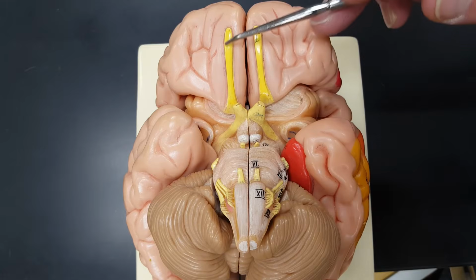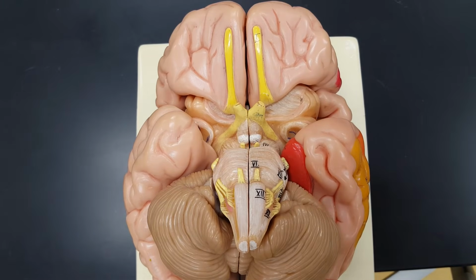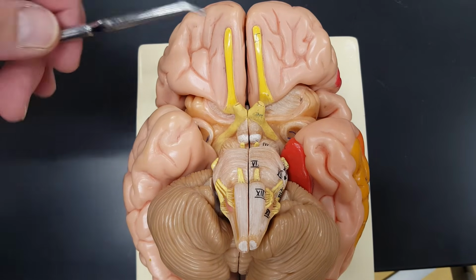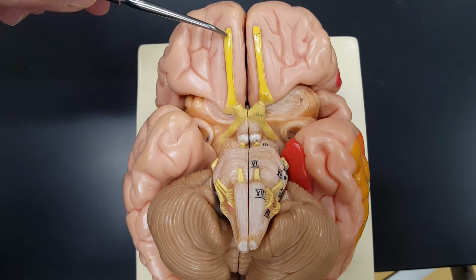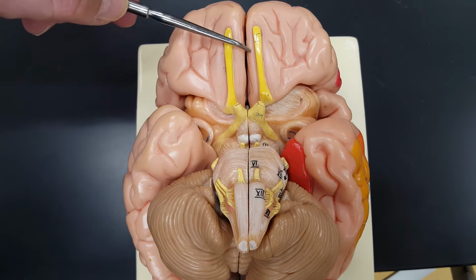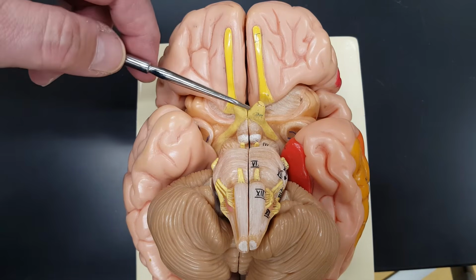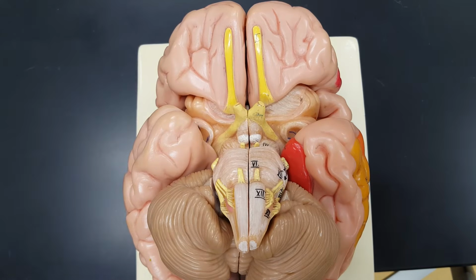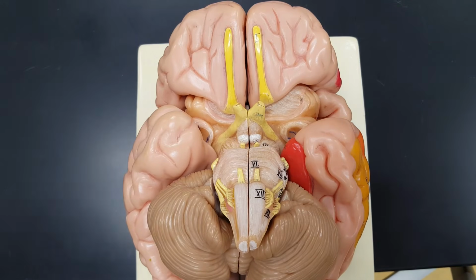These two big nerve tracts are your olfactory nerves for smell, the olfactory nerves. Notice the bulb at each end. So this structure right here is the olfactory bulb. Yours is pretty small. Other animals have much larger ones than we do, but that's the olfactory bulb, and this is the olfactory nerve. Optic nerve, where they meet, optic chiasma, using these mammillary bodies as an anatomical landmark.